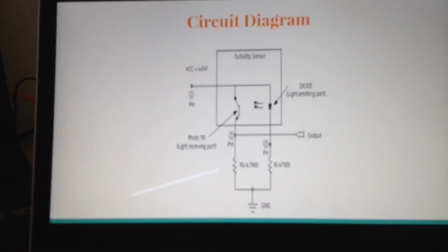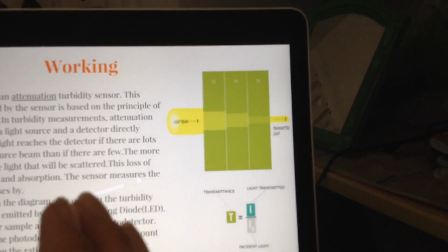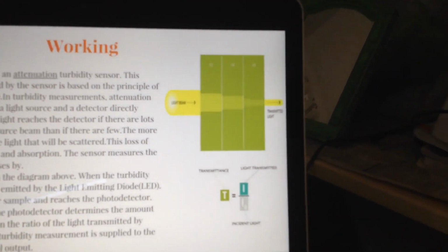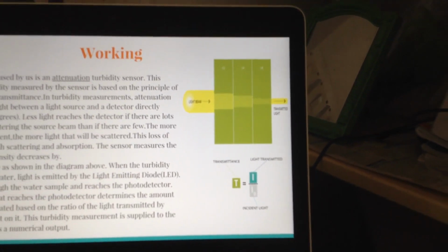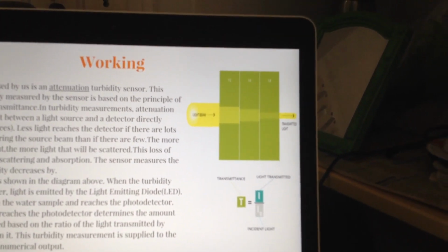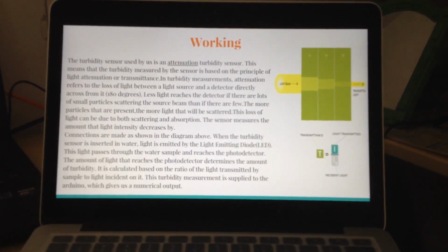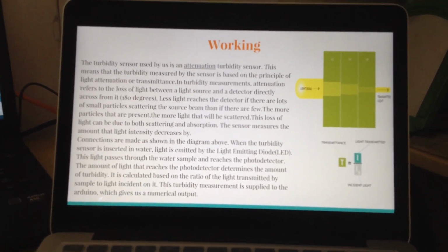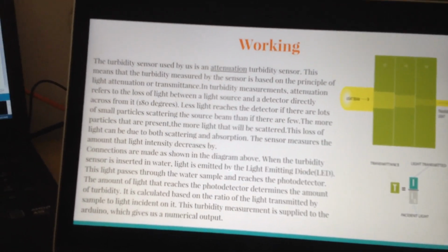Essentially, as we can see, if the light travels through the medium, some of the light is either absorbed by the suspended particles or is scattered, and so naturally the amount of light which is received would be lesser if there is more disturbance in the medium. At the receiving end we have a photodiode which is able to detect the amount of light which it has received and convert it into a corresponding voltage, and that is how we map the turbidity to the voltage, and that is how we are able to quantify the turbidity of water present.